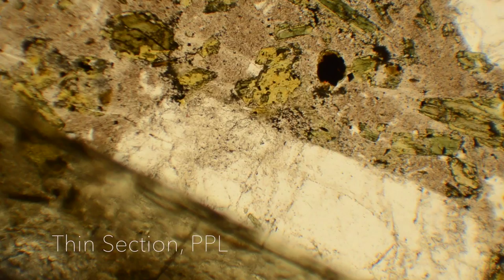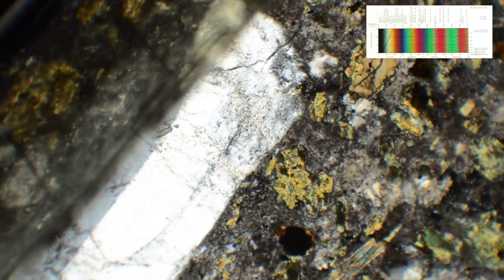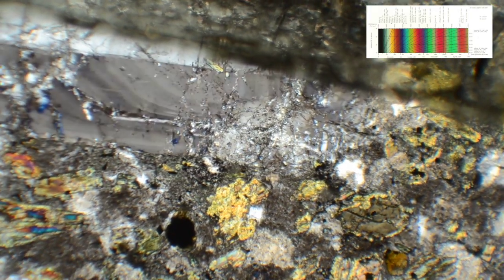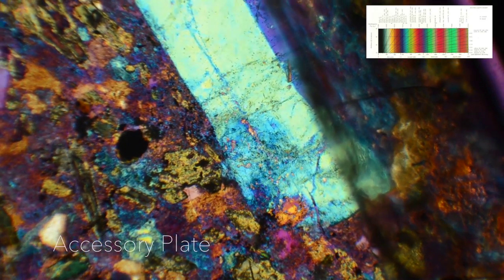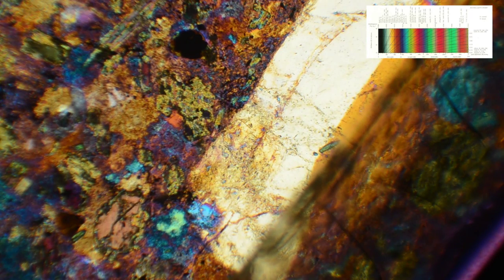Let's try an example of a mineral grain in a thin section. First we start out in plain polarized light. Let's perform this exercise on the large white mineral in the center of the field of view. Here, we insert our analyzers and observe the interference colors in cross-polarized light. The striping that you are observing are zones in which the mineral grew, similar to tree rings. Now I will insert the accessory plate. Here I will rotate the stage such that I am switching between where the fast ray and the slow ray is. See if you can determine which is which.